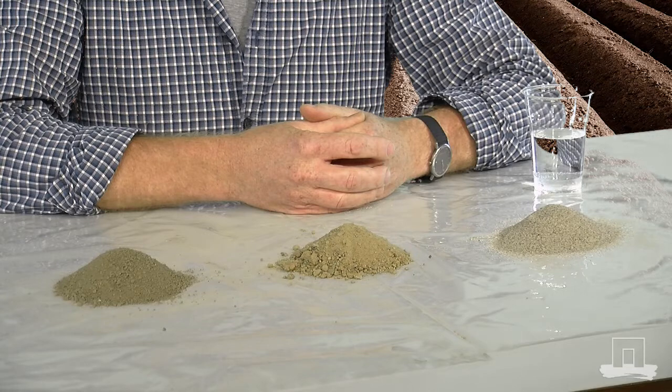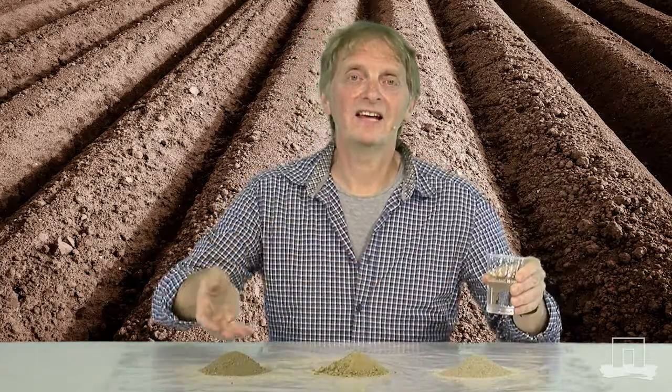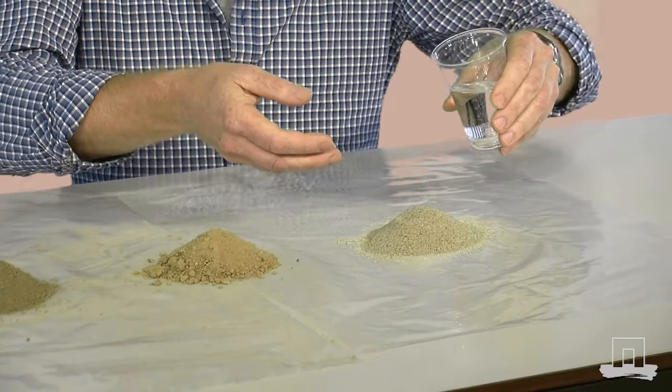To determine soil texture you normally can use sieves, and then you can relate to the different fractions of clay, sand and silt in the soil. However, there's also another very simple experiment you can do using water and different sands and clay and something in between. And here I'll be using sand, which has been taken from the soil of a kindergarten.